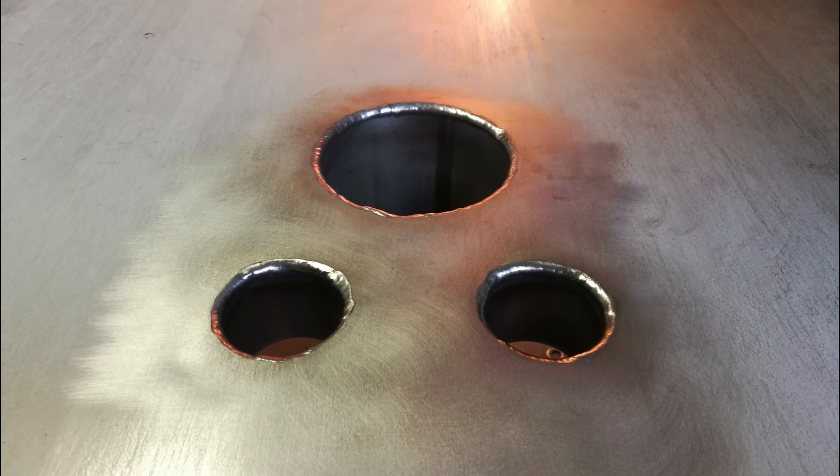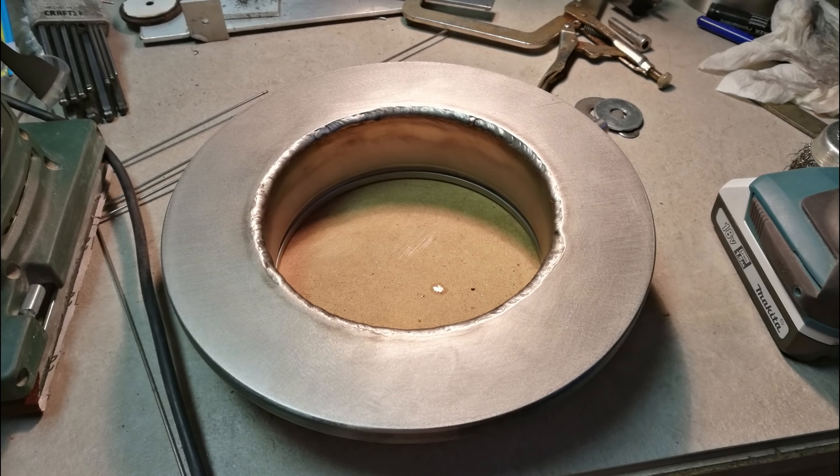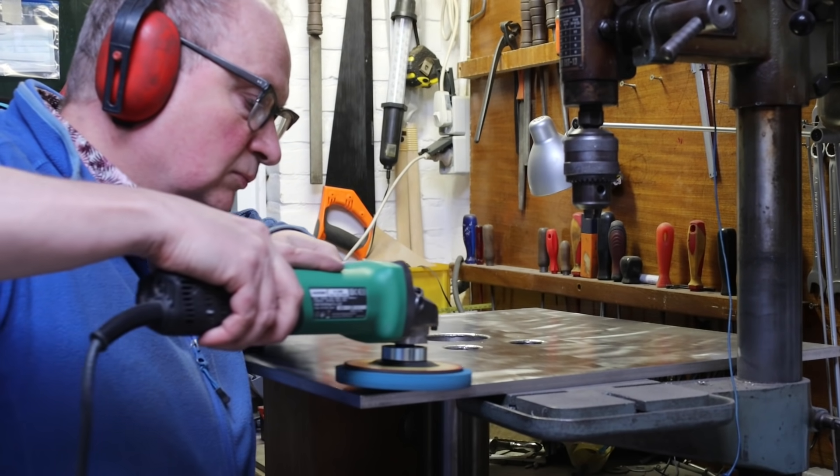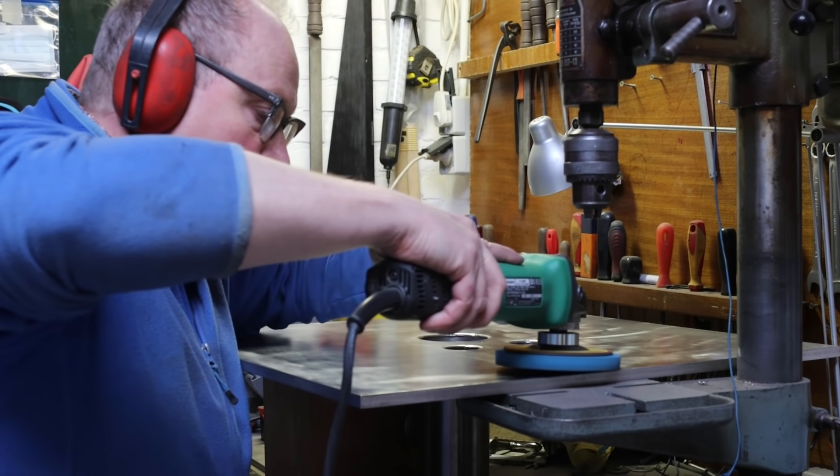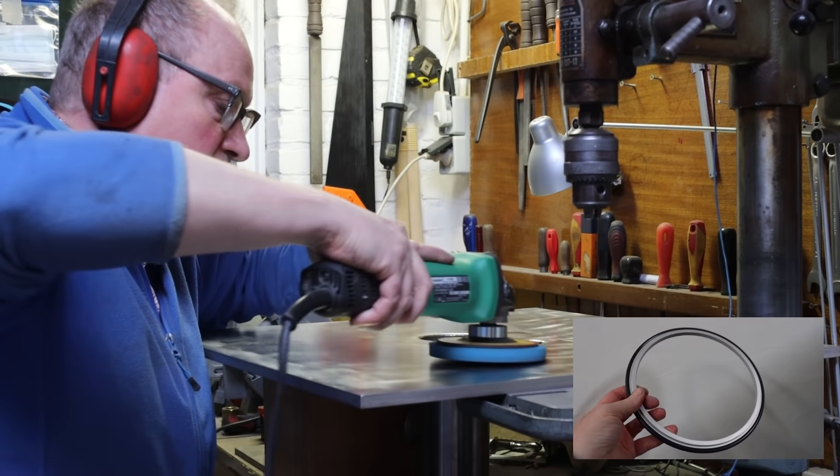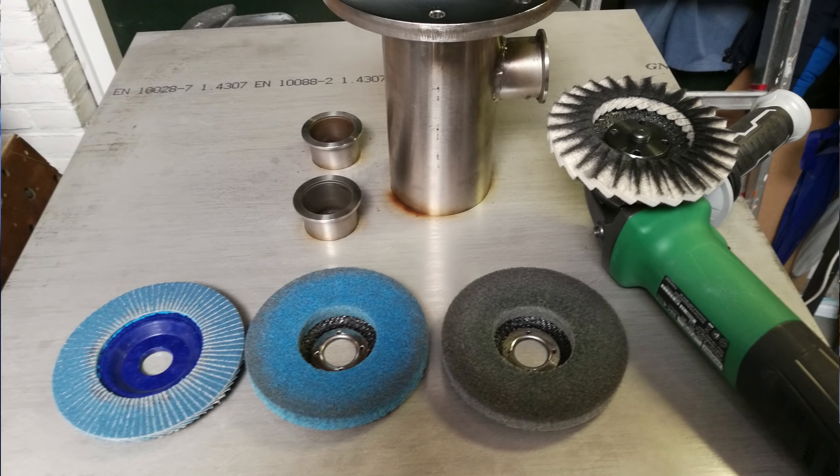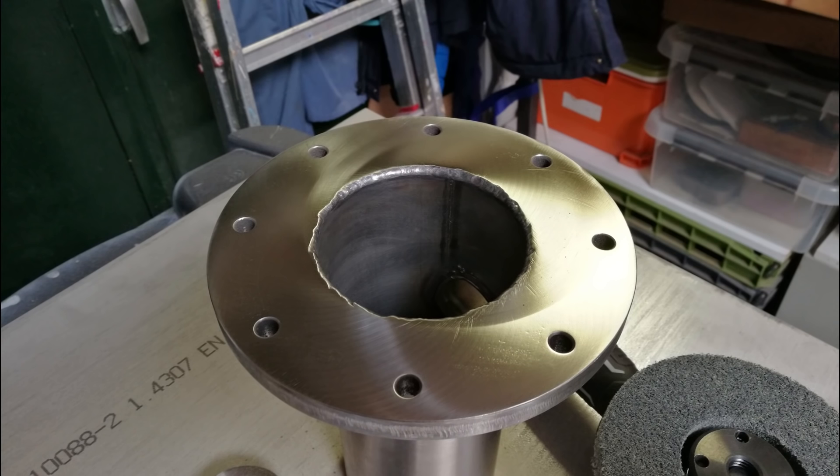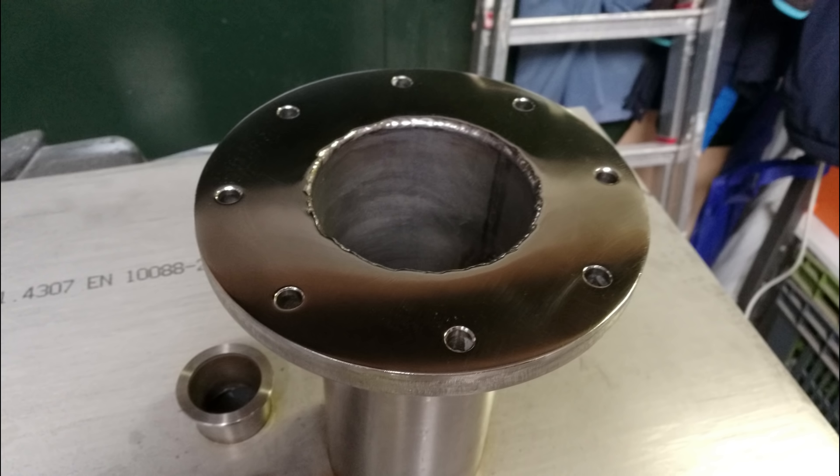After welding, I had to make the contact surfaces between the three parts a bit smoother. The stainless steel plate that I had bought was relatively rough and needed to be flattened and polished before it could be used to make vacuum compatible seals using the large rubber sealing rings. This required several consecutive steps of grinding and polishing before the contact surfaces had an acceptable flatness and smoothness.